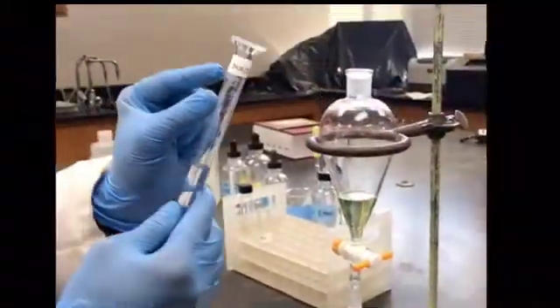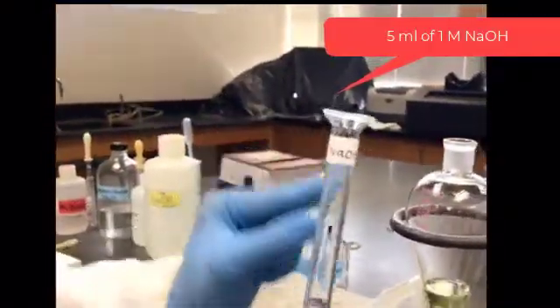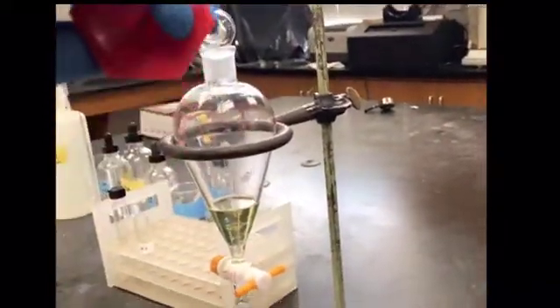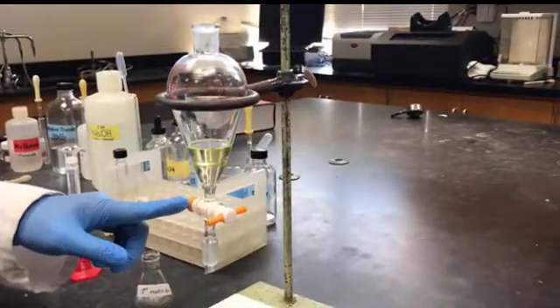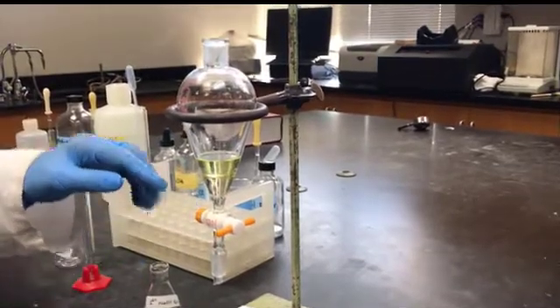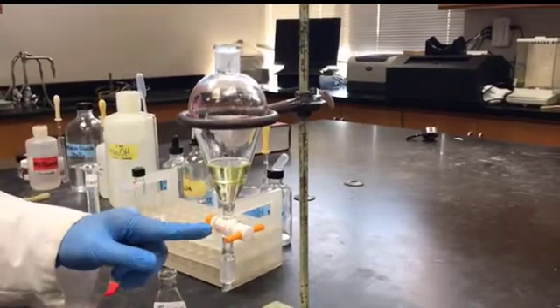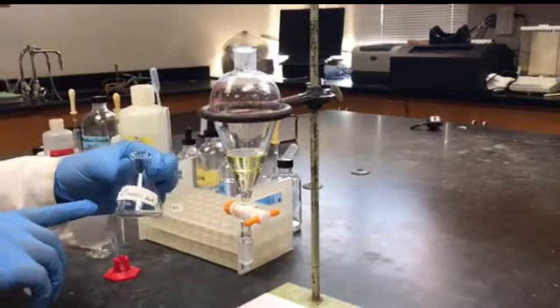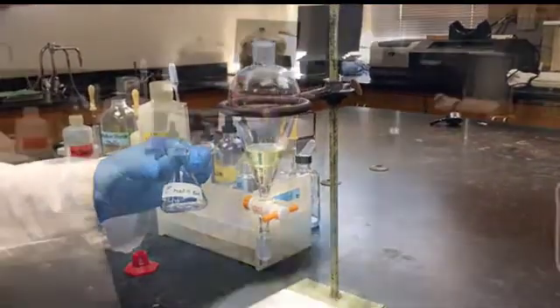I'm going to add now 1 molar NaOH. It is 5 milliliters of 1 molar NaOH that I'm going to add to it. Now I will shake the separatory funnel for 30 seconds, the same way as you have seen in part A, so that the acid impurity will come into the aqueous layer. And then I'm going to separate both the layers. So the lower layer will go into this Erlenmeyer flask labeled first NaOH extract.